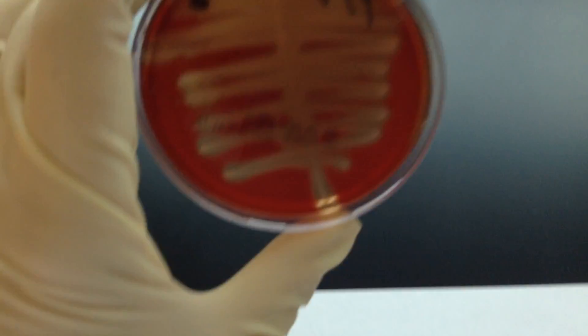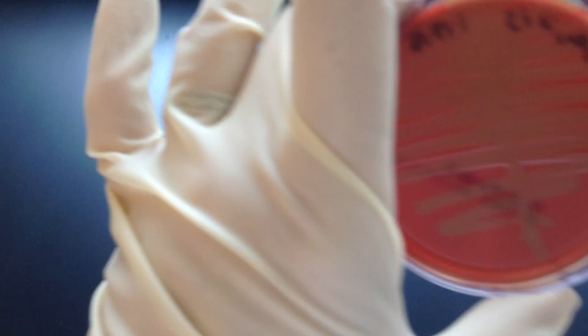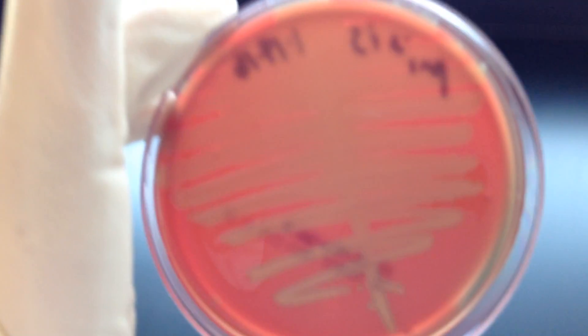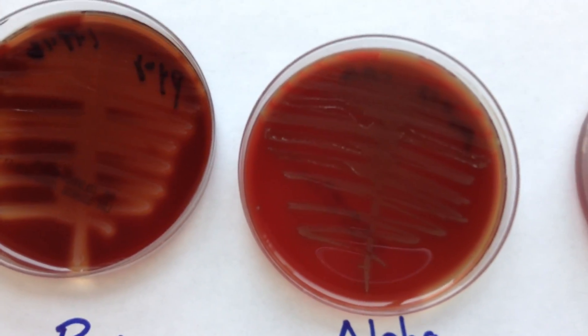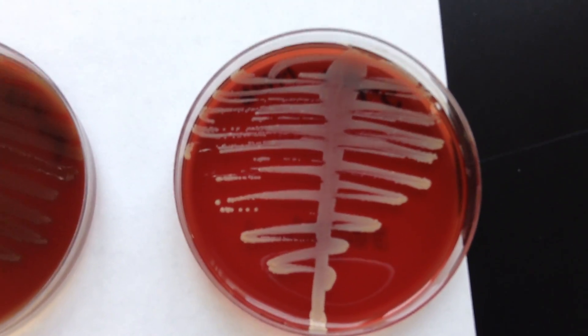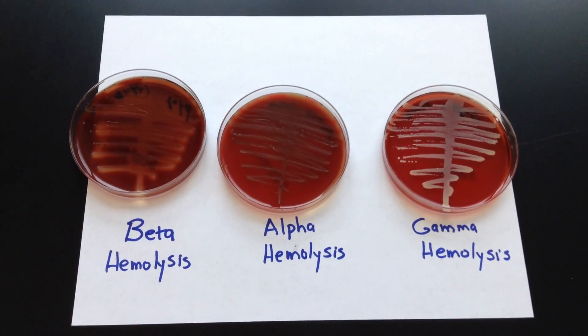Make sure you practice looking at these, and holding them up to the light or a light background can often help. Here's our beta, here's our alpha — don't be afraid to turn these over when looking at them in lab — and here's the gamma. So again: beta is complete lysis of the red blood cells, alpha is a partial digestion or lysis of the red blood cells, and gamma is no digestion or lysis of the red blood cells. That is the TSA blood plate and its hemolytic reactions.